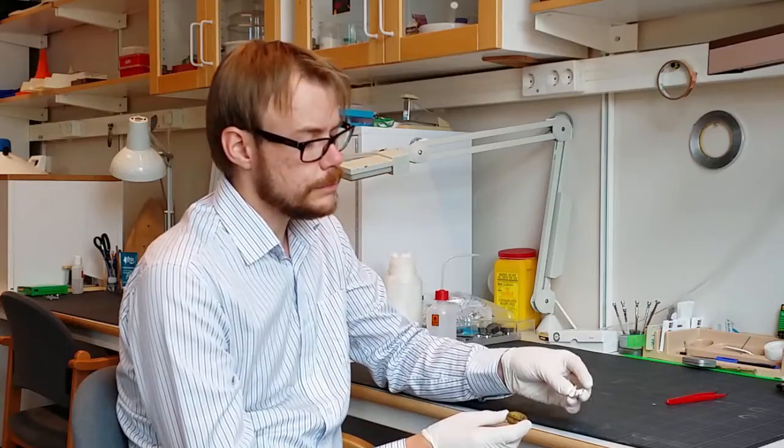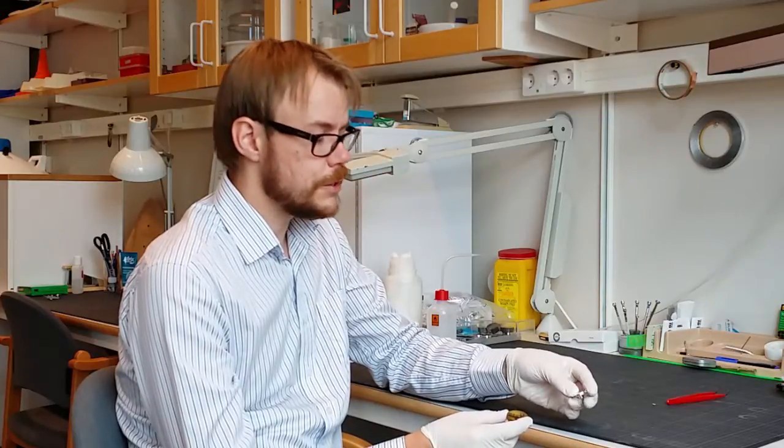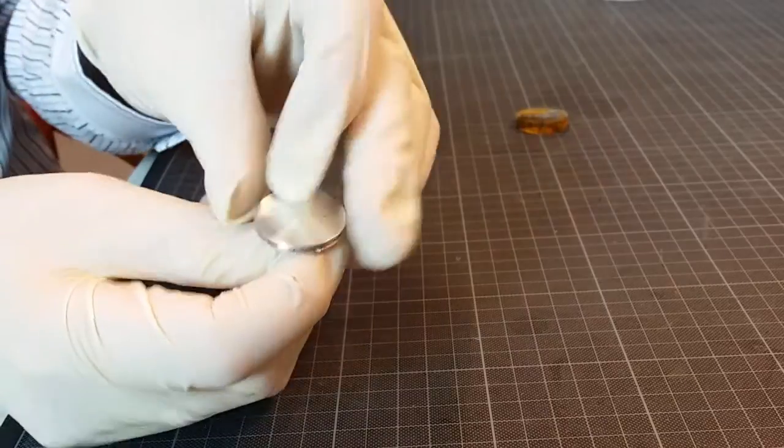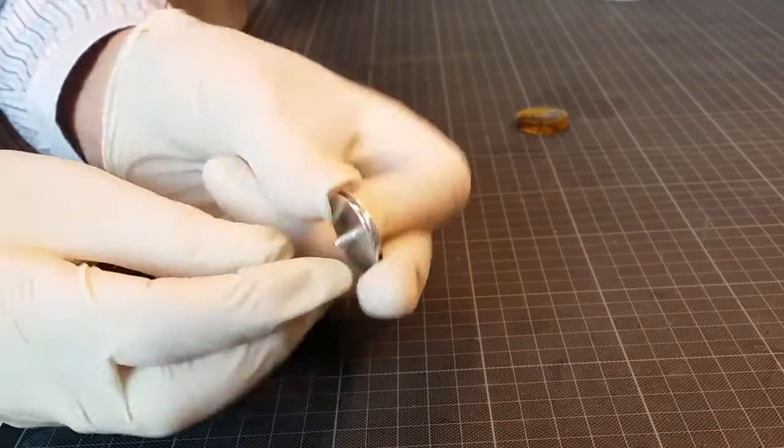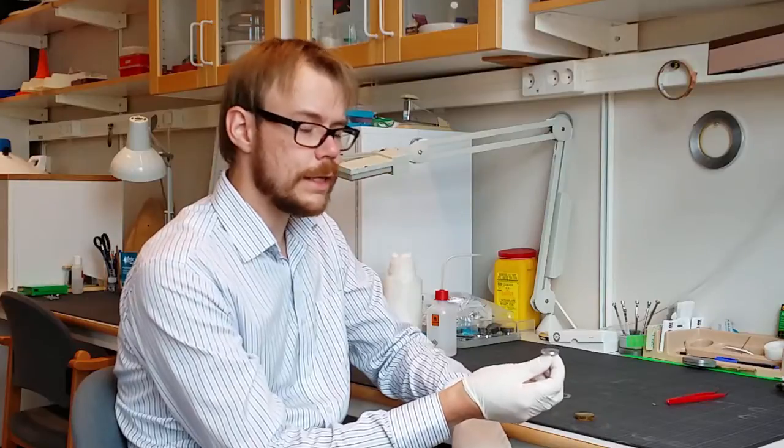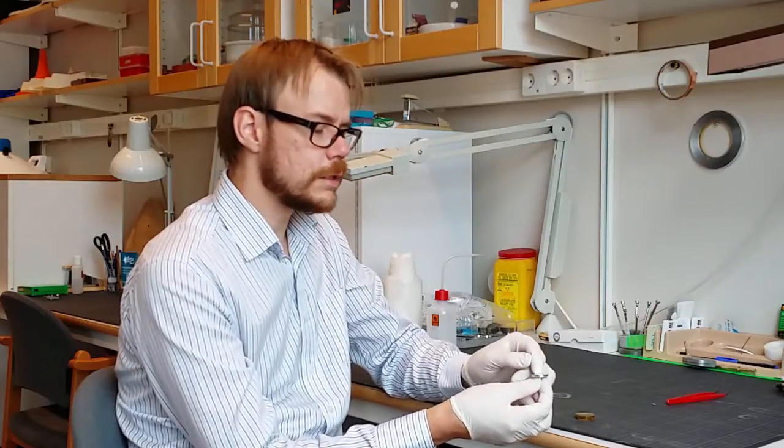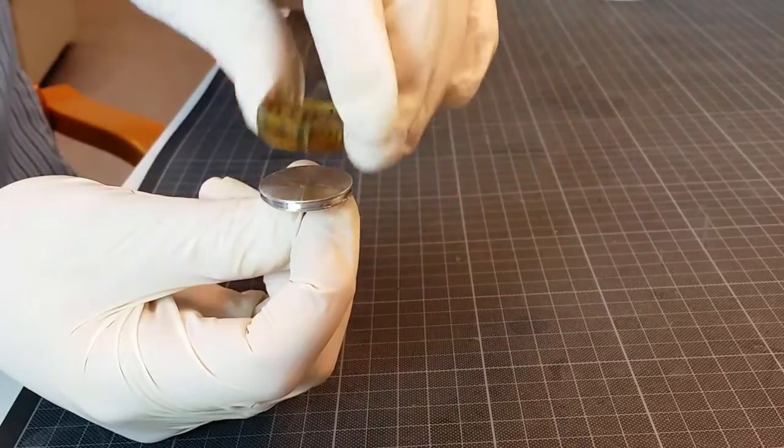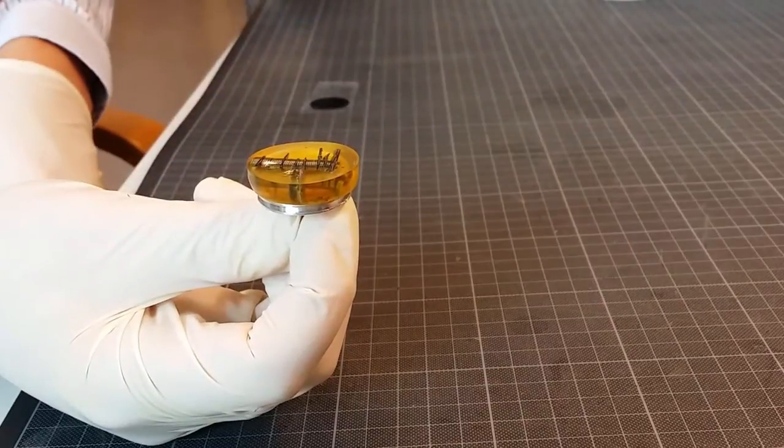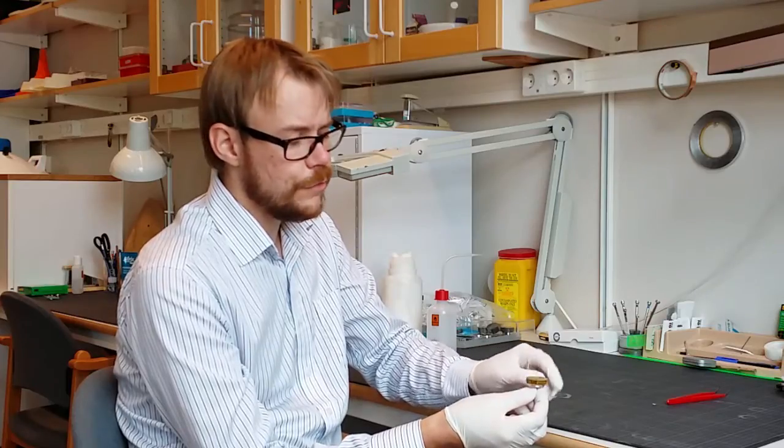Here is the sample holder, a small aluminum cylindrical dish. On the bottom here you have a smaller cylinder that actually is a fixation in the machine, so the machine will hold it like this. And then this plate will be grounded and conduct the electric charges away. So the idea is to mount this sample on top and create an electric pathway of the charges so it will be grounded off.